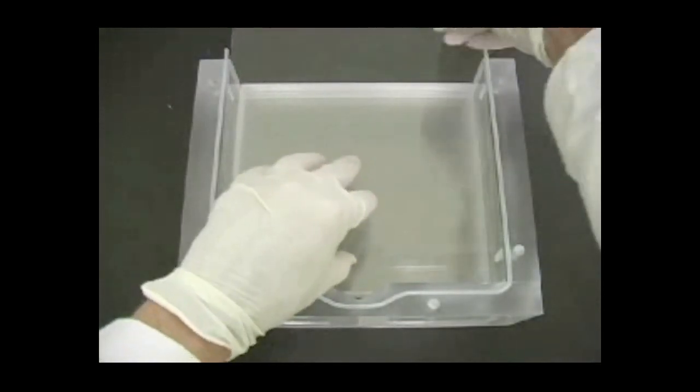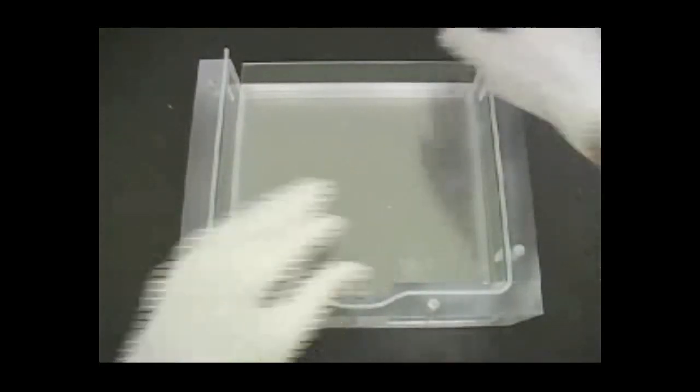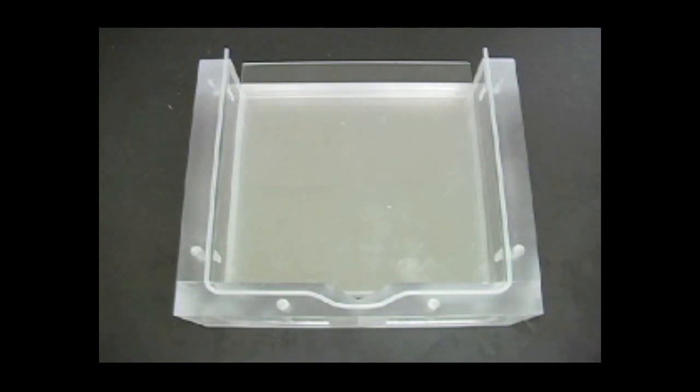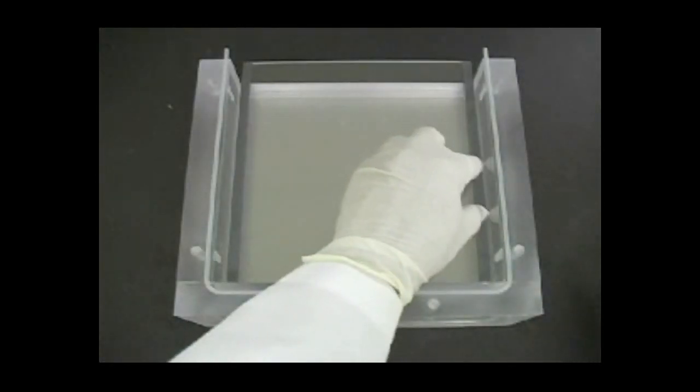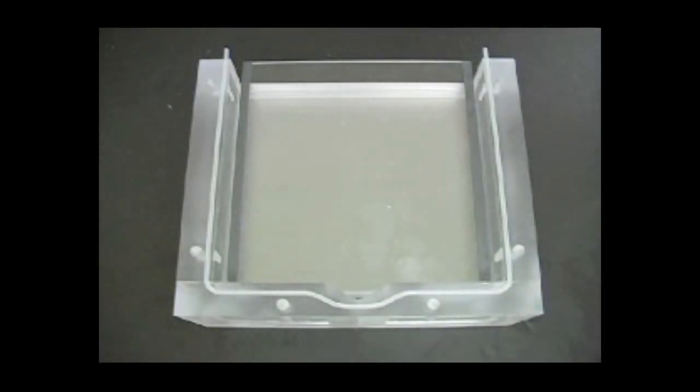Place a long outer plate on top of the separation sheet. Put one set of narrow spacers on the first glass plate so that they are seated firmly against the side walls and lower corners of the chamber.